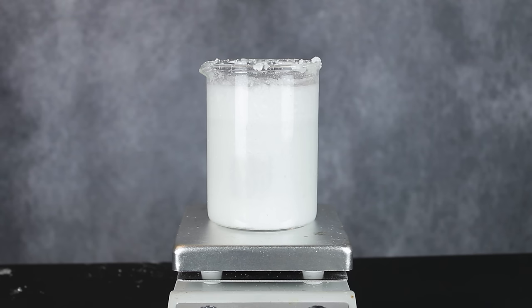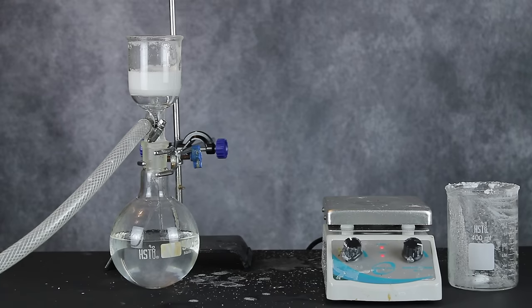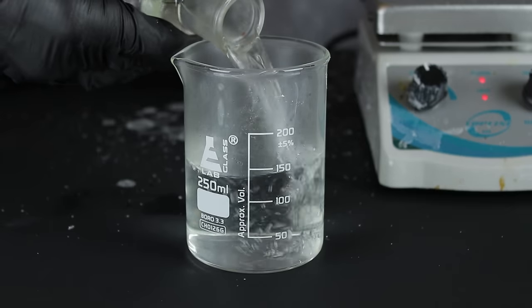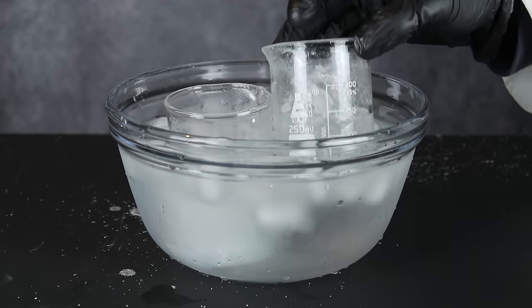The major side product in this reaction is di-tert-butyl urea, which is less soluble than the desired mono-tert-butyl urea, meaning we can get rid of most of it through hot filtration, which is exactly what I did. The solution that made it through the filtration was poured into a separate beaker, well, two beakers, and chilled on ice to precipitate out the tert-butyl urea.